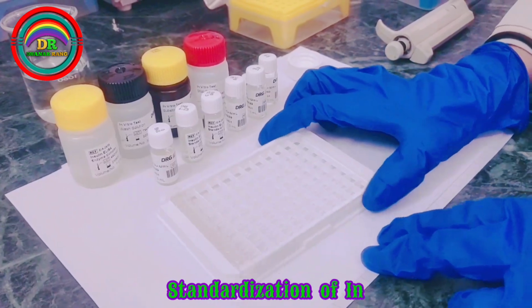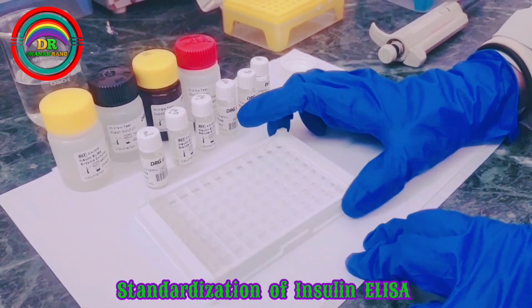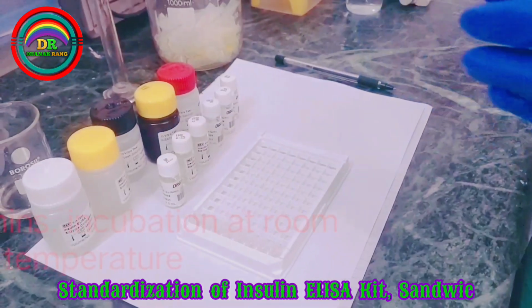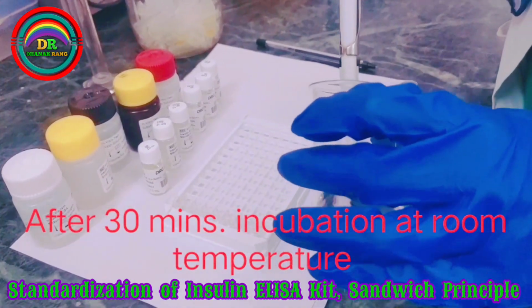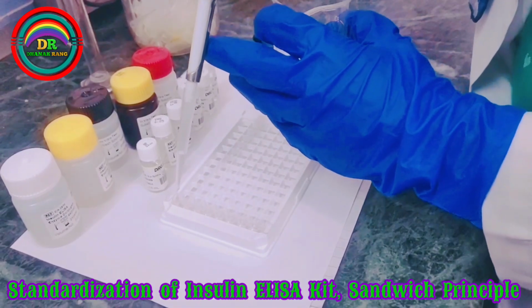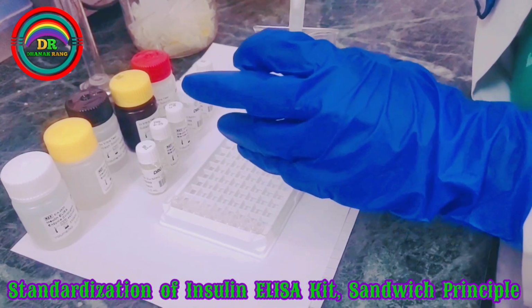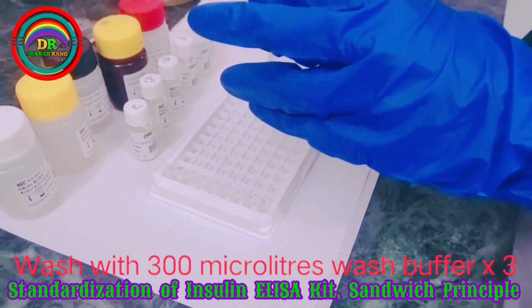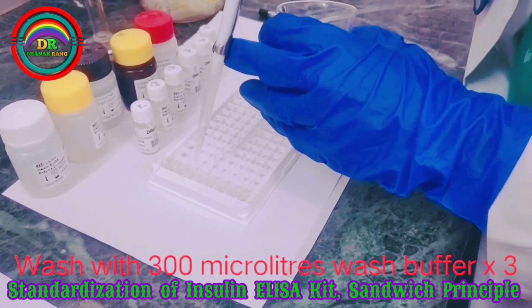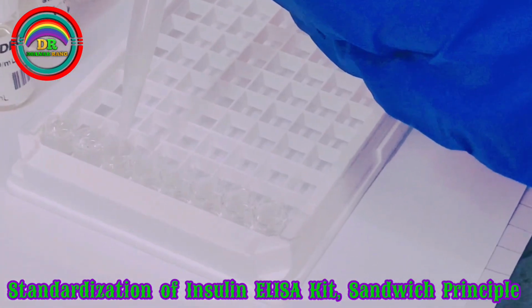And we'll mix and incubate it for 30 minutes. Now we'll proceed to the next step, in which we will wash each well with the wash buffer. For this we are taking 300 microliters of wash solution of 1x concentration in each well.